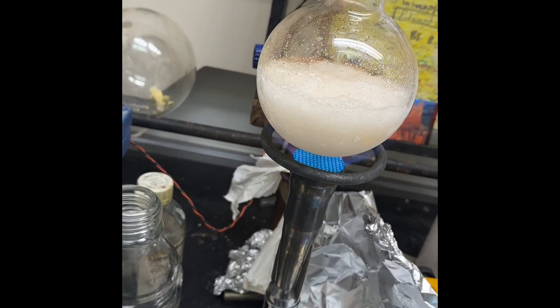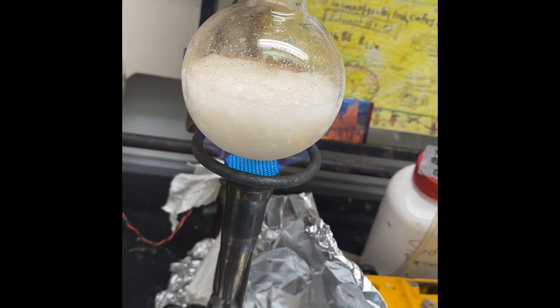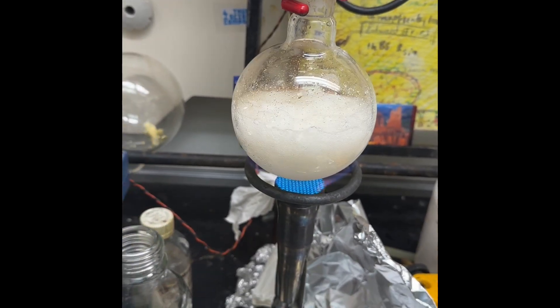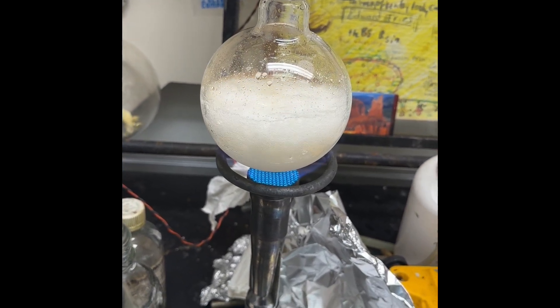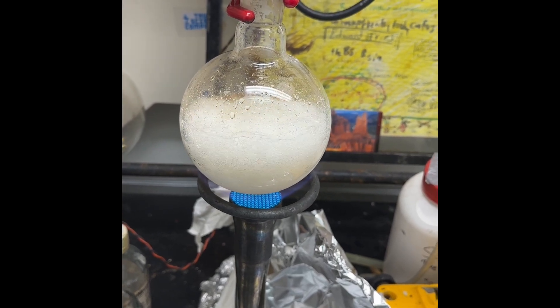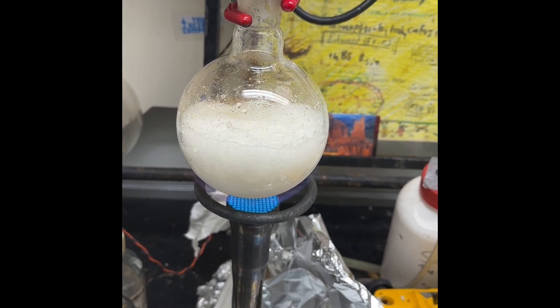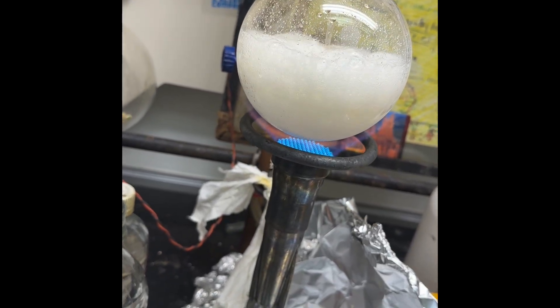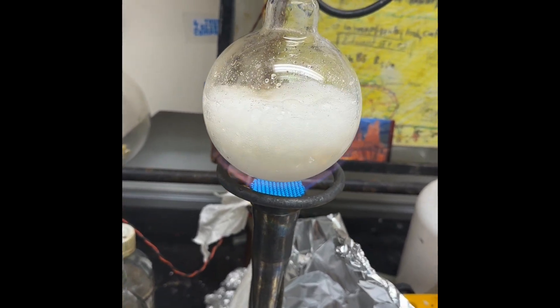If you're wondering how the hell is this not cracking being heated like that? The cracking of glassware from heat is thermal gradient. So if it's already hot, you can crank it to a higher temperature, it's going to be fine as long as you don't exceed 100 Celsius of a difference, which it's not in this case.